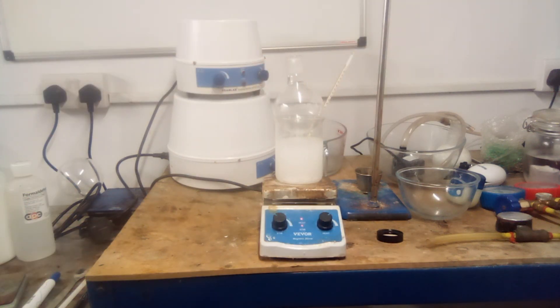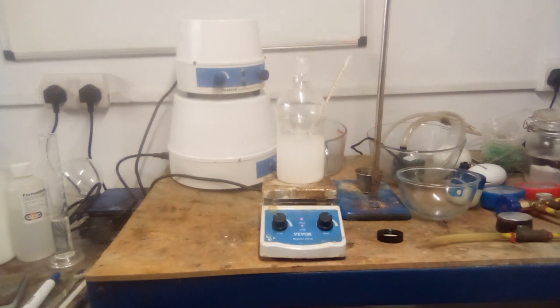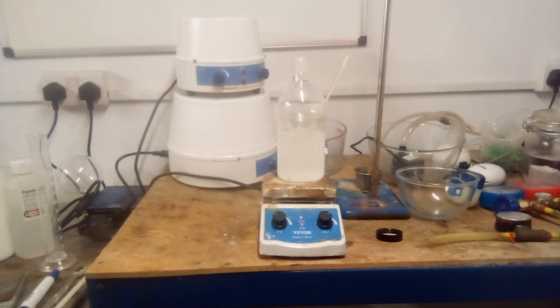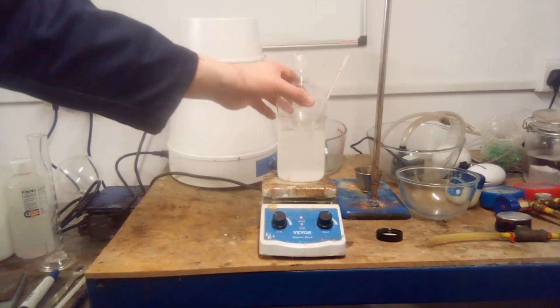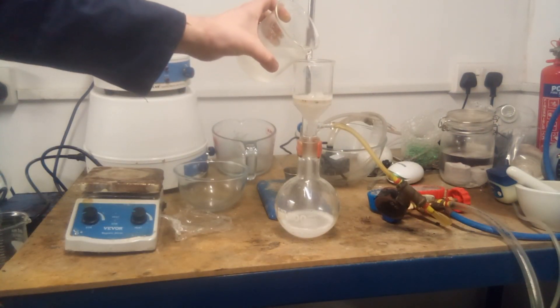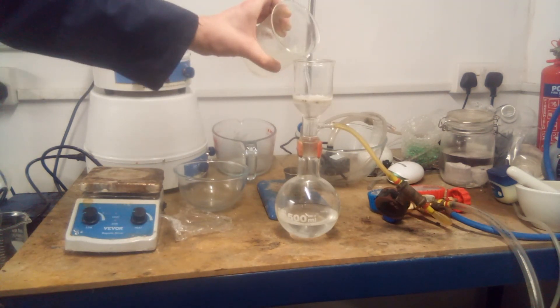The mixture was then heated to boiling using a crude kind of reflux setup, and sufficient water was added to dissolve the fine solids — about 70ml in total. At this point I noticed that some of the coarse insoluble precipitate from the first reduction had been carried over to this point without dissolving, so I carried out hot filtration to remove it, transferred as much of the fine precipitate to the filter as I could, added a little more water at the boiling point to re-dissolve it, then cooled it overnight in the fridge. As the final product is not very soluble in either water or alcohol, it precipitates out properly, and it was recovered by vacuum filtration as small coarse plates. It needs a wash with acetone to remove any retained water.